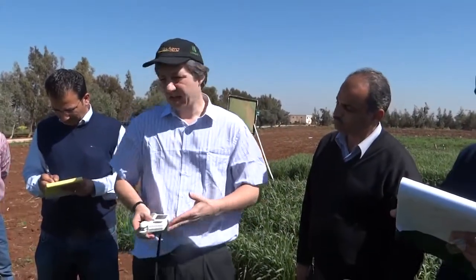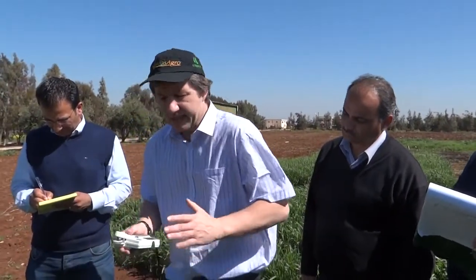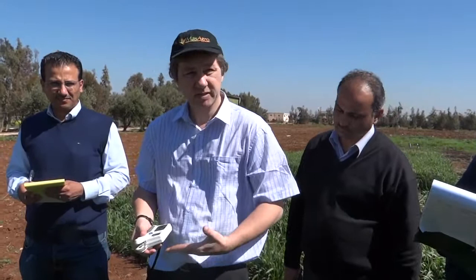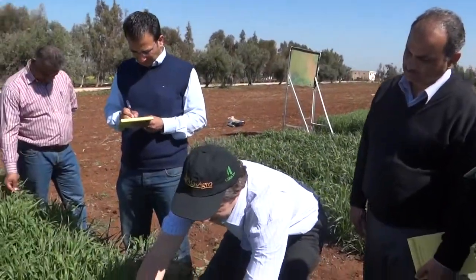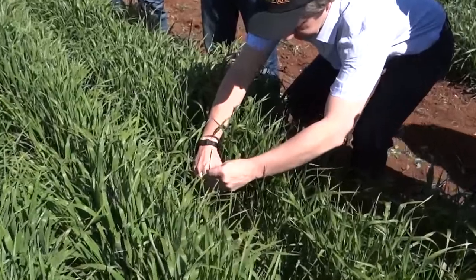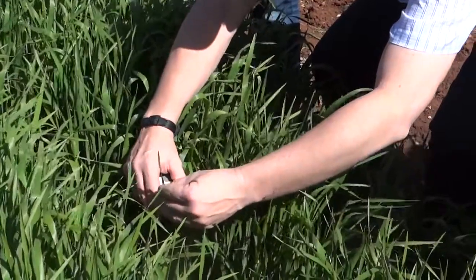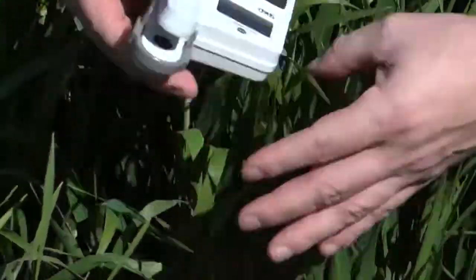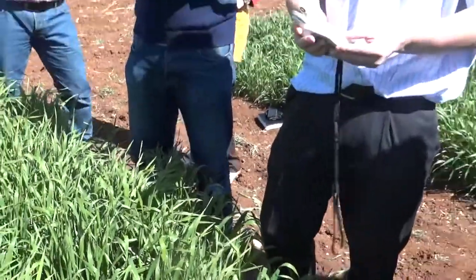Normally we take up to about five readings per plot. It's worth noting that there can be a gradient of chlorophyll within the leaf, so it can be useful to take three readings per leaf — at the bottom of the leaf, in the middle, and in the distal position as well.